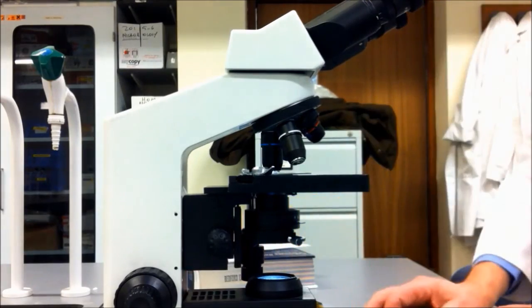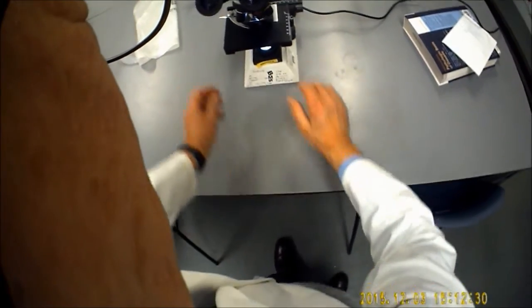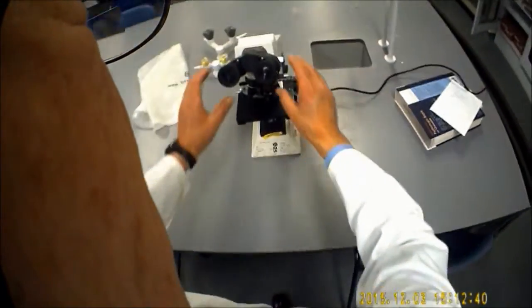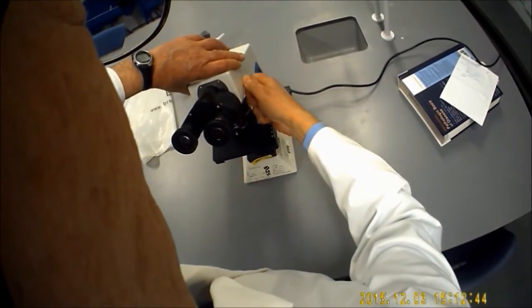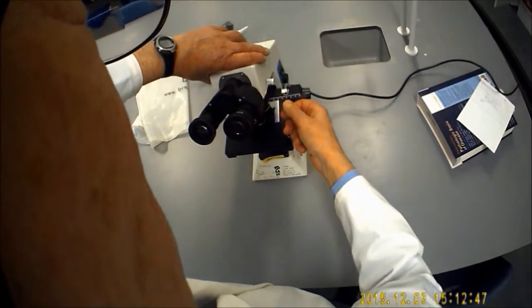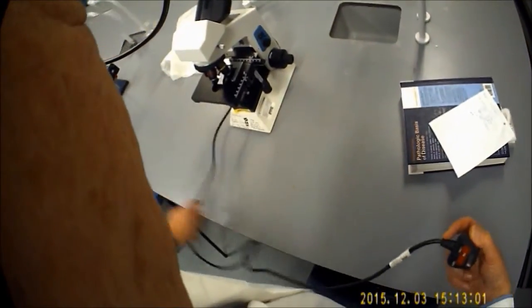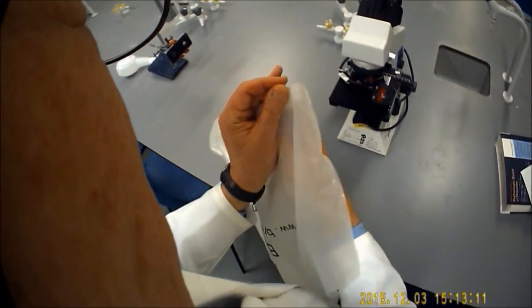Once you've finished, turn the microscope off, remove the slide, and put it in your slide container. Just move the eyepieces slightly together, slacken off the silver knob on the side, and return the eyepieces to their starting position. Unplug and wrap the cord up so it's tidy.